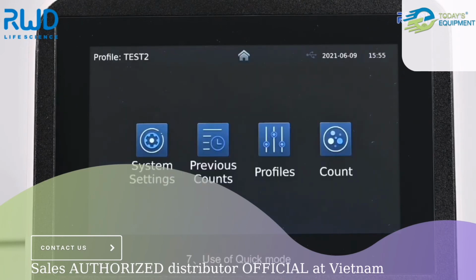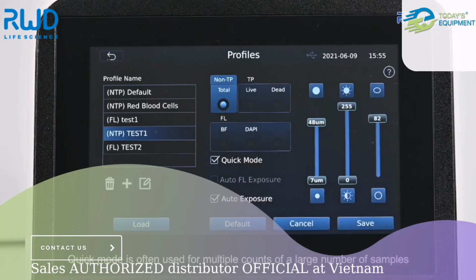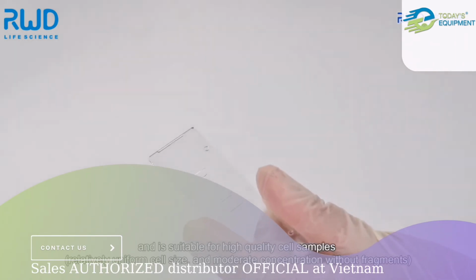Seven. Use of Quick Mode. Quick Mode is often used for multiple counts of a large number of samples and is suitable for high-quality cell samples.